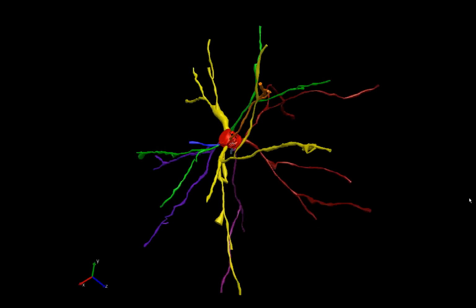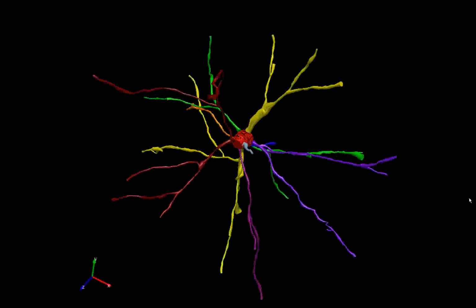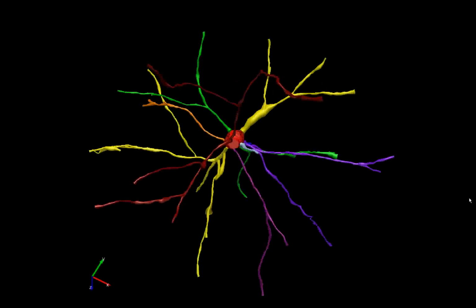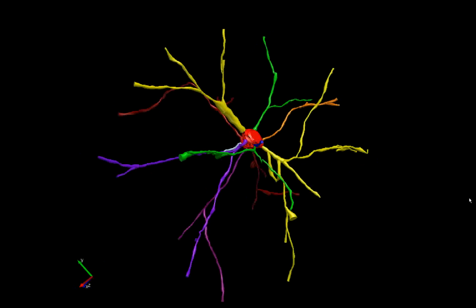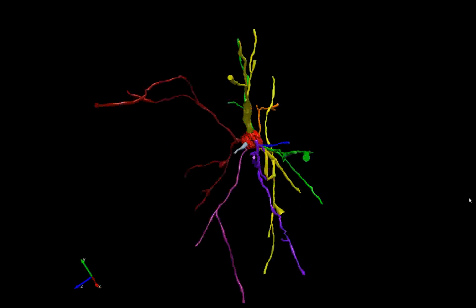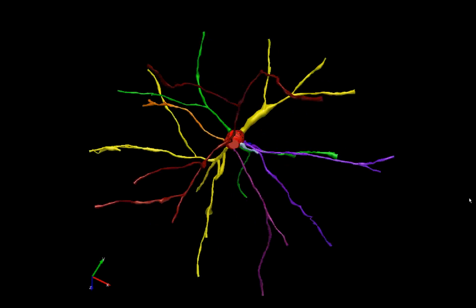With computer-assisted neuron tracing, the user traces by placing points along a neuron, either manually or automatically. And this can be done in both 2D and 3D, on live or captured images, and from a single section or many.